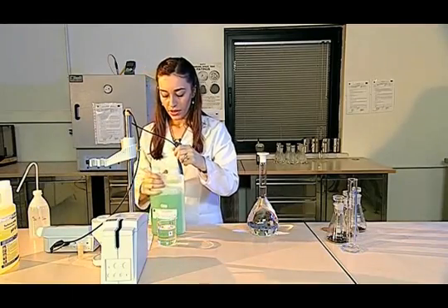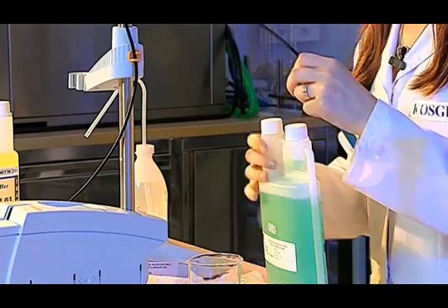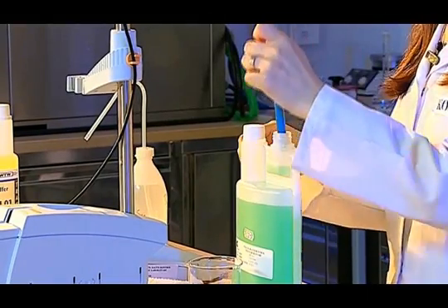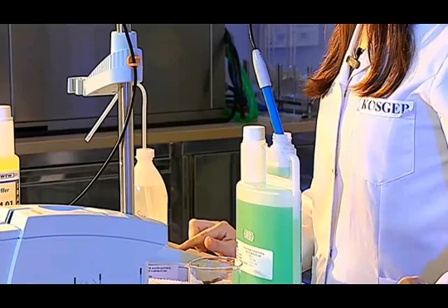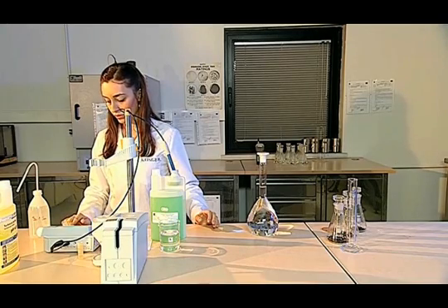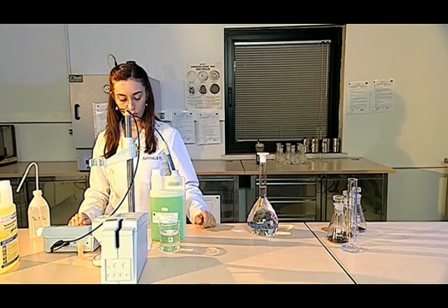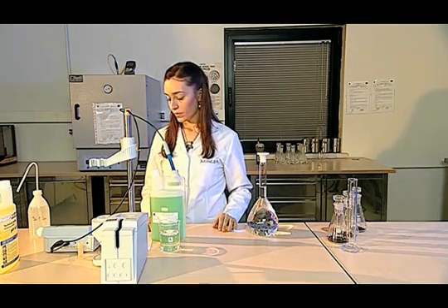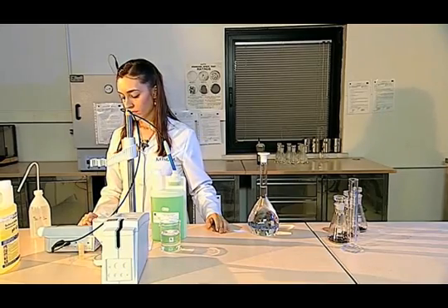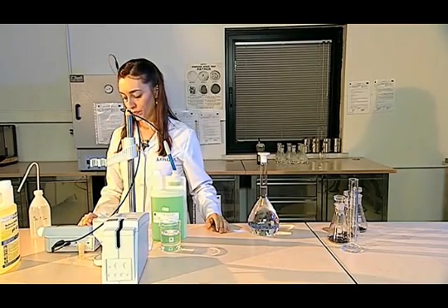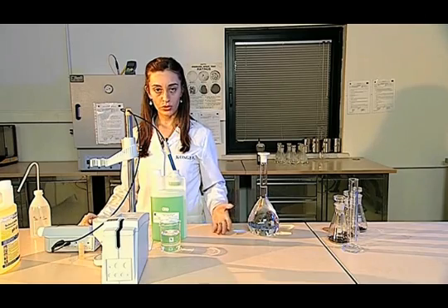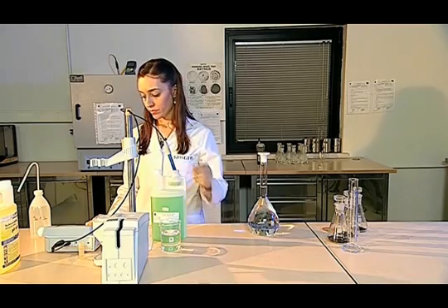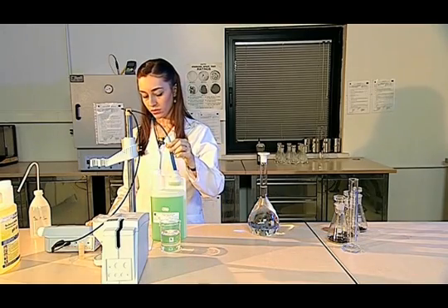We use pH 7 and pH 4 buffers for the calibration process. We start the measurement with the calibration step in pH meter. First, we find the asymmetry value in pH meter. The measurement is completed when the pH is fixed. We compare the value we see with the table value and decide that there is no problem with the calibration of the pH meter if the value is between the value range.